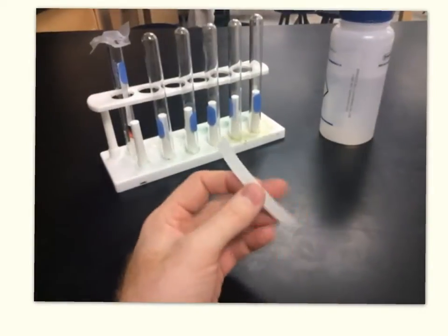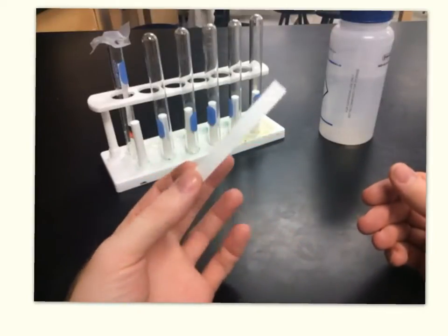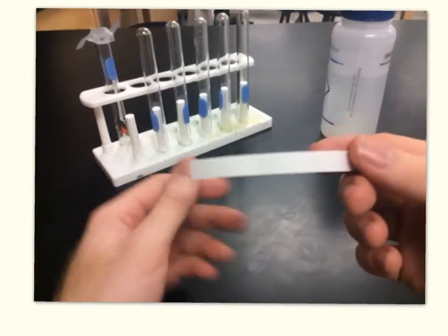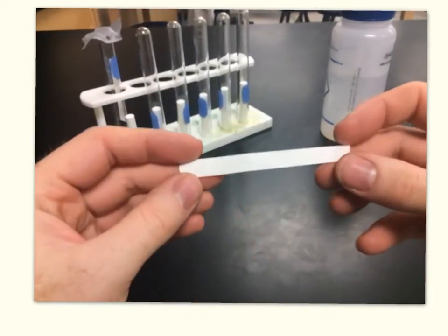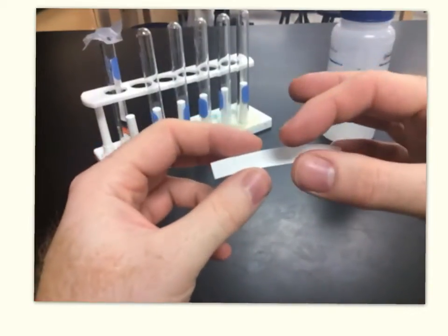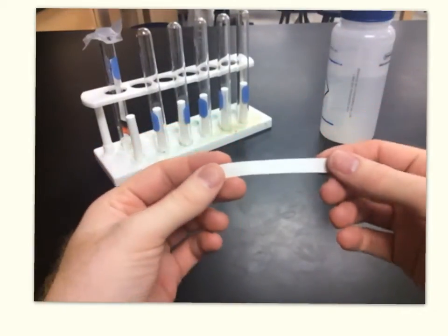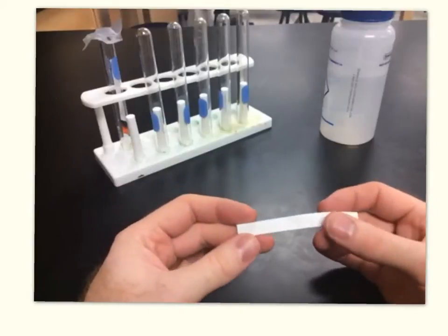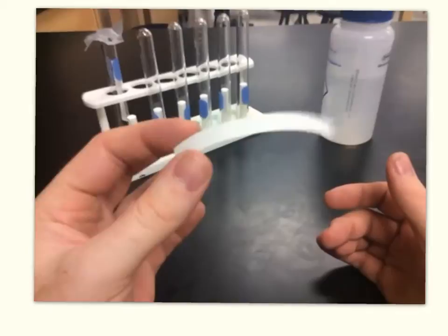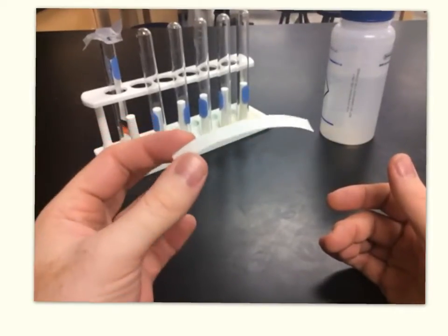This is just a brief overview of the lab procedure. You still have to read the procedure and follow it as you go, but I just want to show you what to expect. So this is my piece of chromatography paper — it's not the same thing as regular copy paper. It's a lot more expensive because the pore size, the little tiny holes in the paper, are very consistent. That's really important for repeatability, so every time you buy this paper it's got the same size pores.